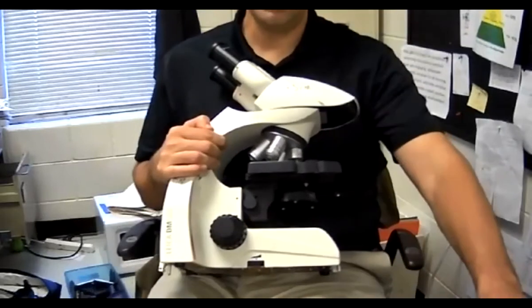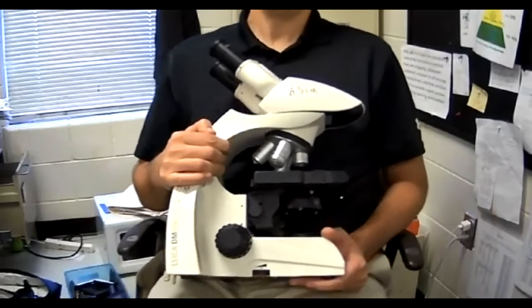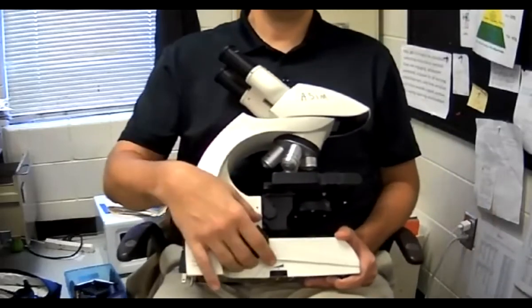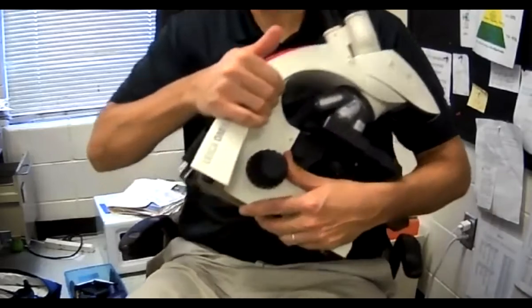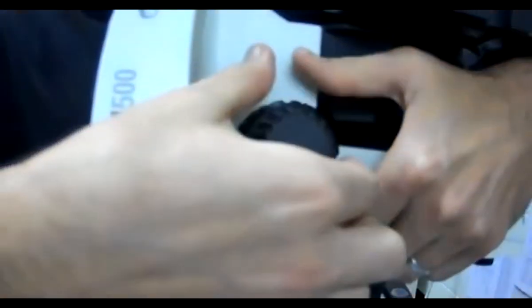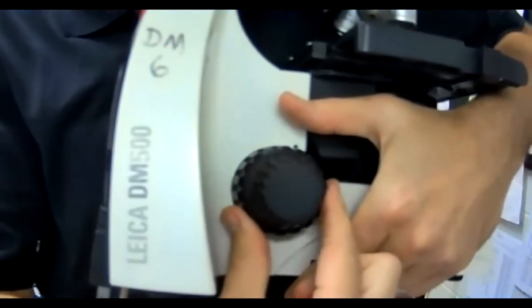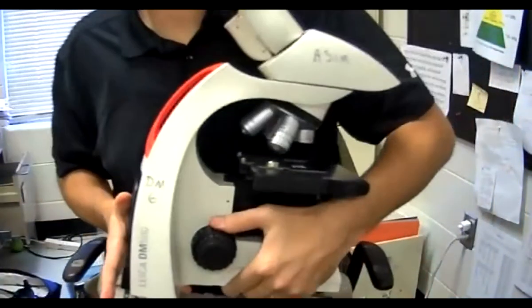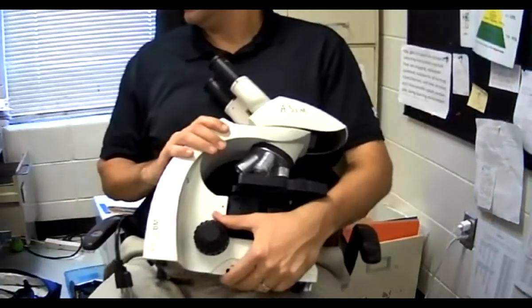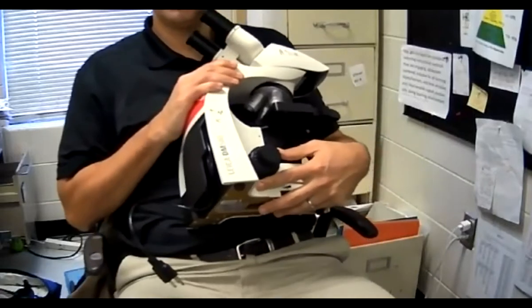I'm going to go over it on my microscope quickly. The next part is the big adjustment knob. You're going to see that this has two knobs on it — there's the big knob on the back and there's the little knob on the front. The big knob is called the coarse adjustment.